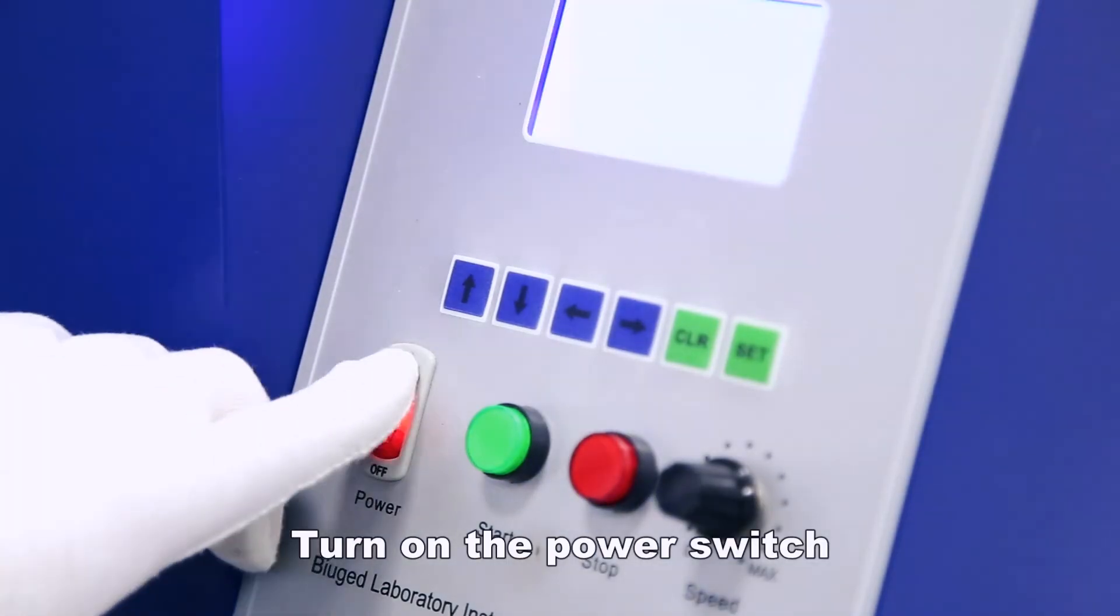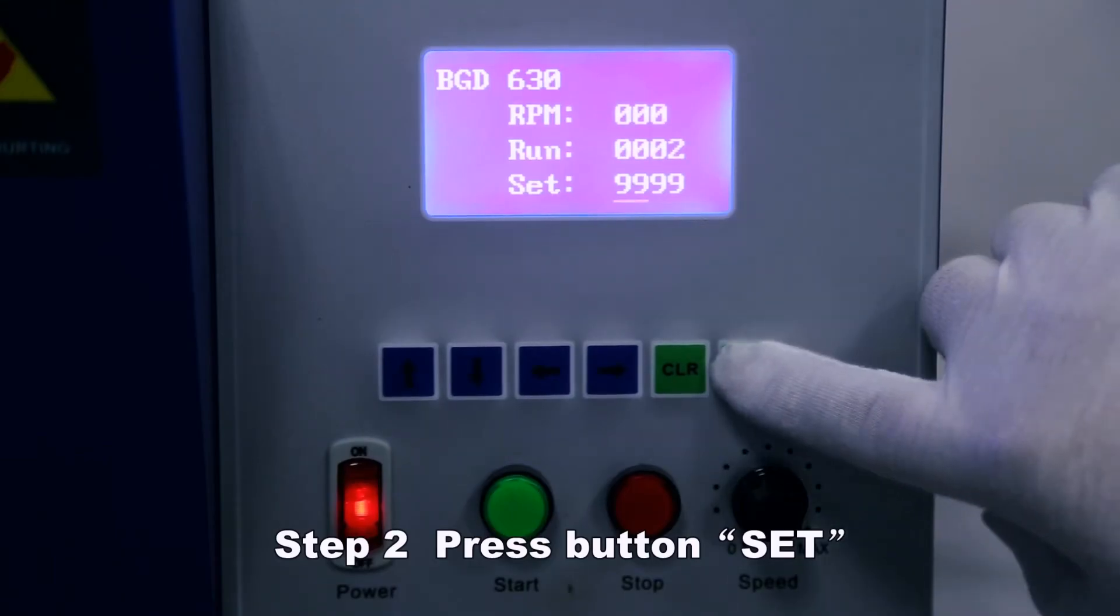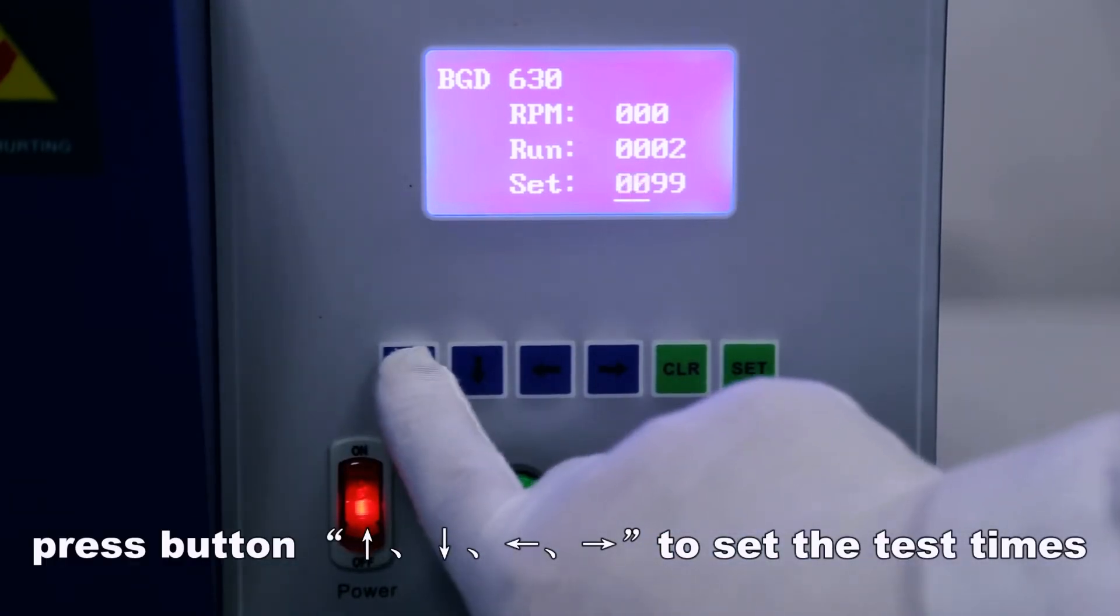Turn on the power switch and press button SET. Press the button to set the test times.